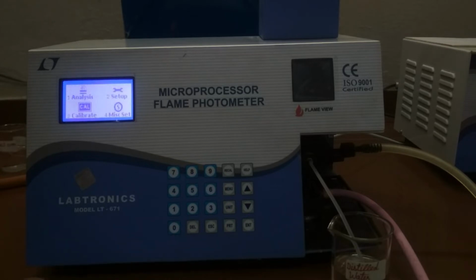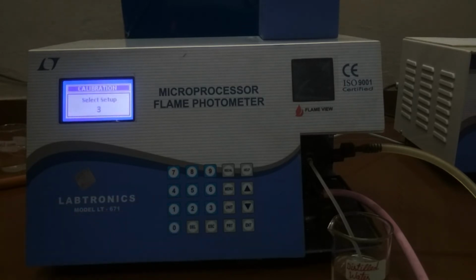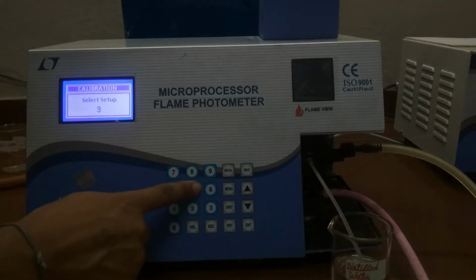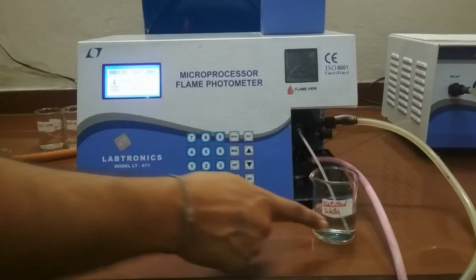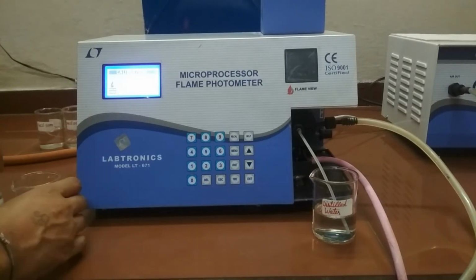Now we will do calibration. Press numeric key 3 to select calibration. The value of the last setup chosen is automatically displayed. Press the corresponding numeric key to select setup for calibration. In our case, it is 5. Now press enter key. The display shows aspirate blank solution. Now put the capillary in the blank solution, that is distilled water, and press enter key.